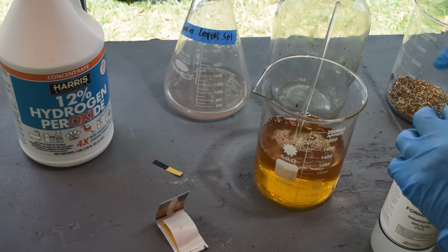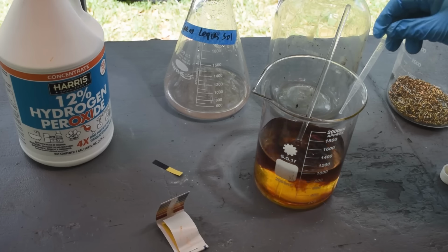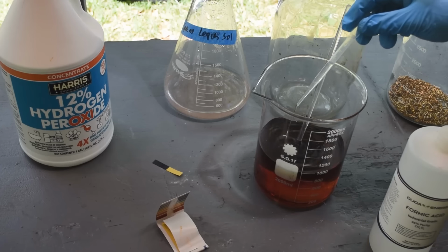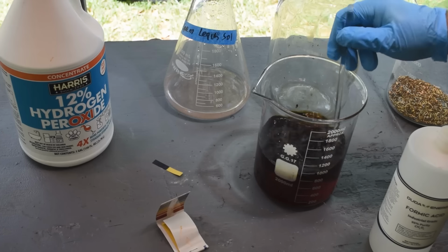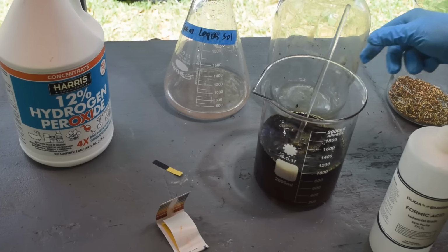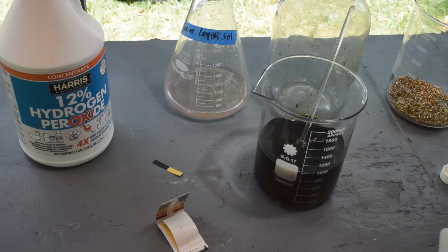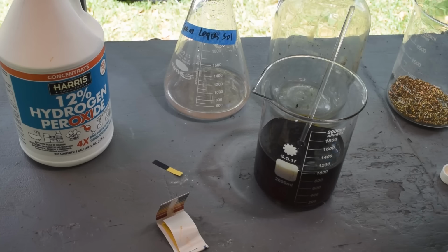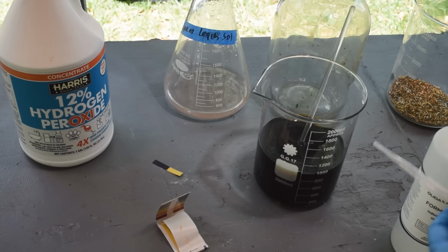And it looks like it's mostly going back into solution again. So a bit more. So Altec recommends the use of formic acid for adjusting the pH of the iodine leach. It doesn't add any chloride ions to it like using hydrochloric acid would. And it should escape the system as carbon dioxide when it reacts with the alkali in here. So we shouldn't actually be leaving a lot of residue behind.